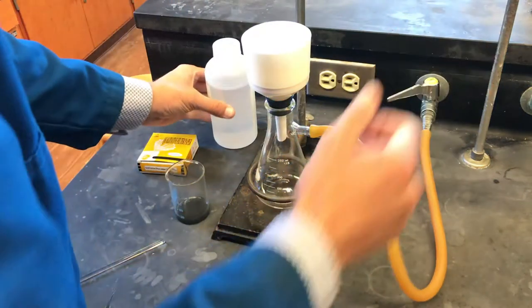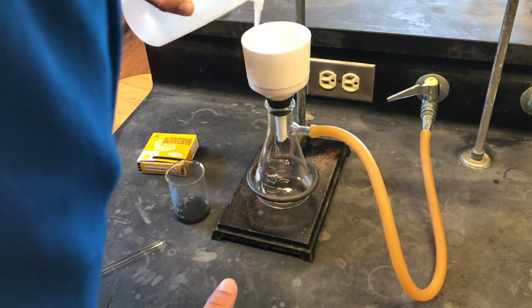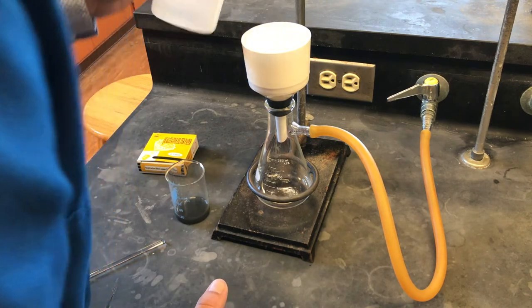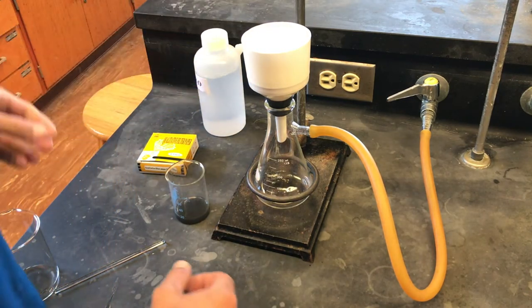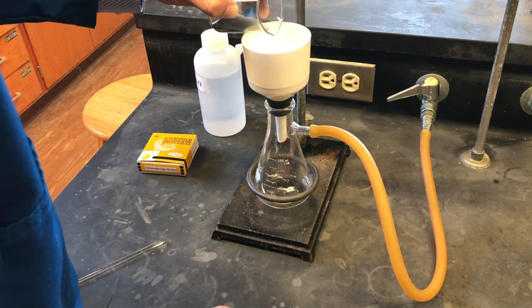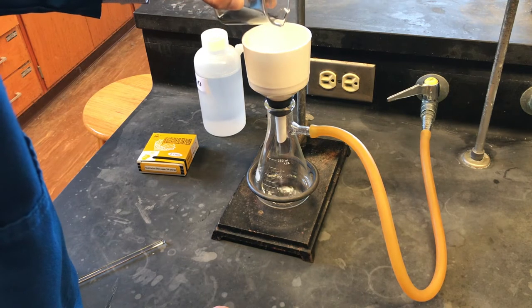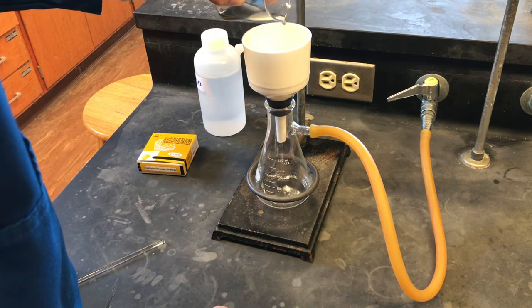We'll turn the house vacuum on and wet the filter paper with DI water to reduce solution loss during filtration. I'll then pour our solution slowly in the center of the filter paper, careful to ensure the liquid never reaches the edge of the filter paper.